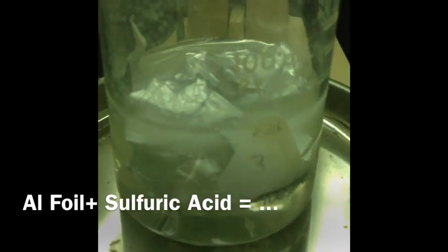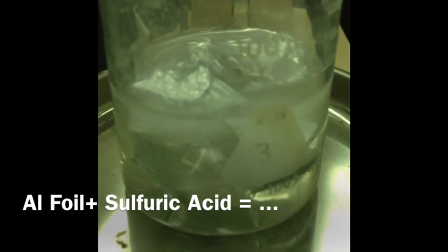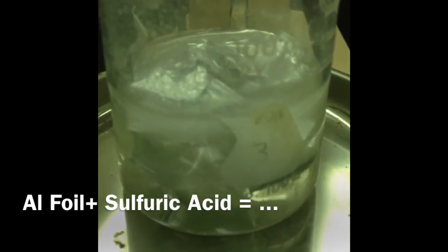Oh, you gotta wait a few minutes when it starts being a little violent. Besides, if you want it to explode, why don't you just hock a loogie in it? See what happens.